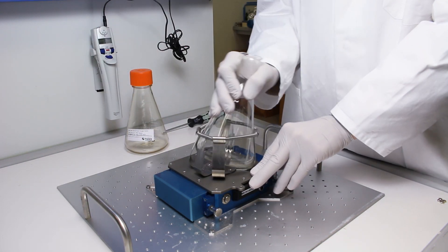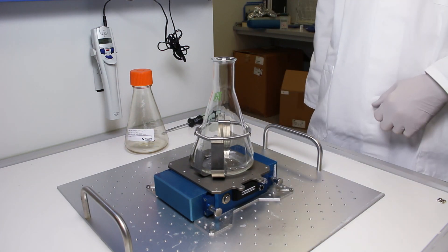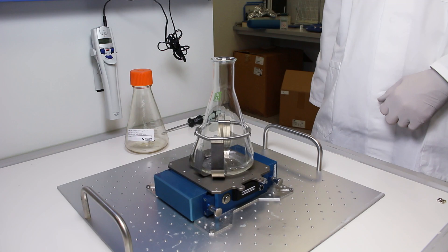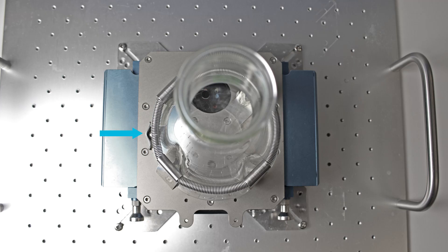You can bend the arm inwards to better fit your glass flask. For self-prepared glass flasks, the side arm is used as an orientation guide. Here you can see, when positioned correctly, the O2 sensor should be directly above the left optics.